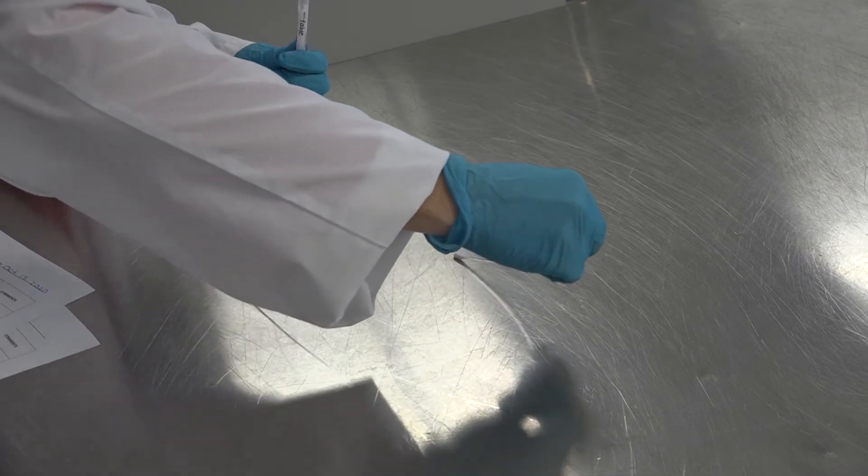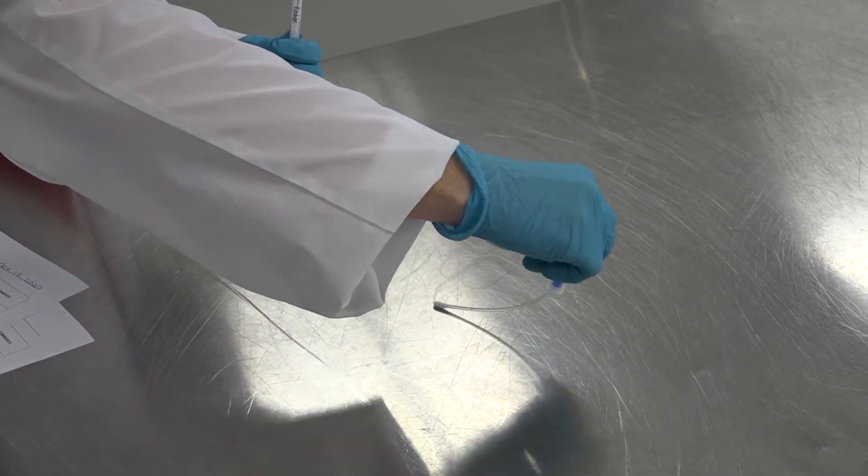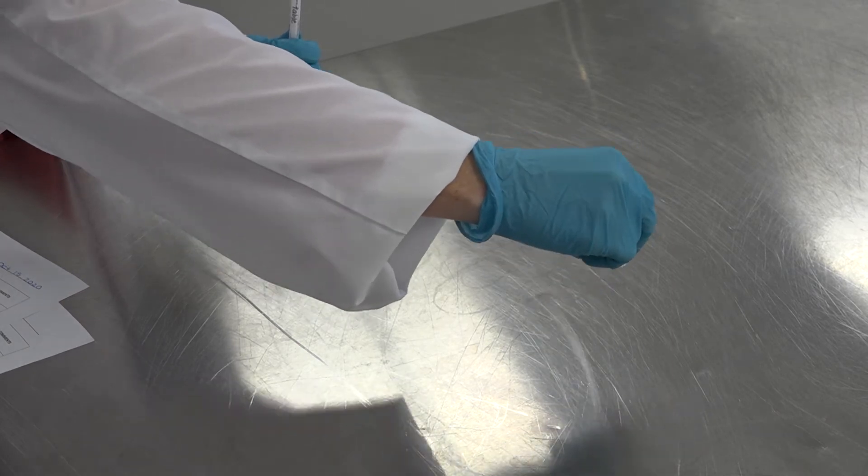Use an even pressure rotating the shaft of the swab. Be careful not to touch the shaft of the swab.